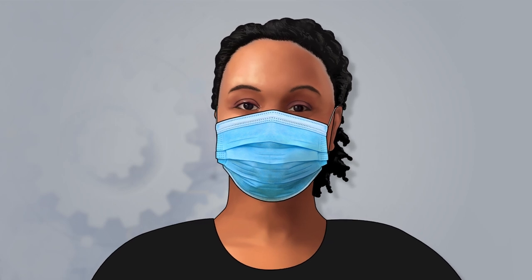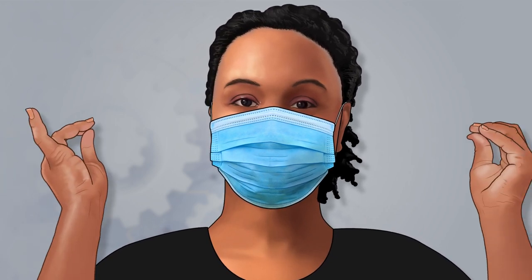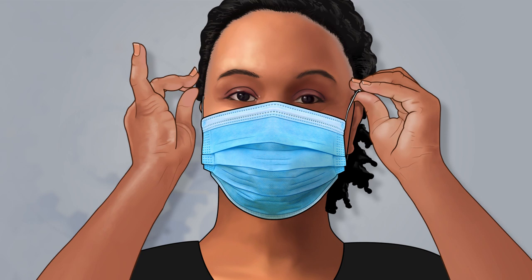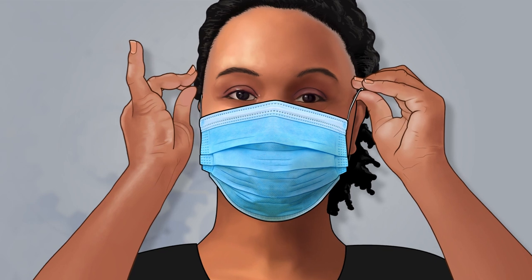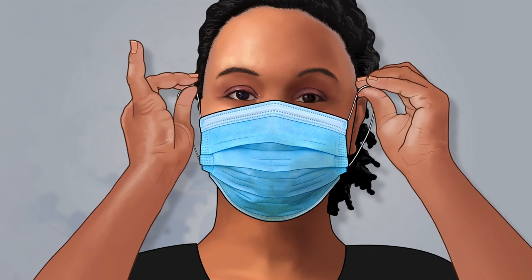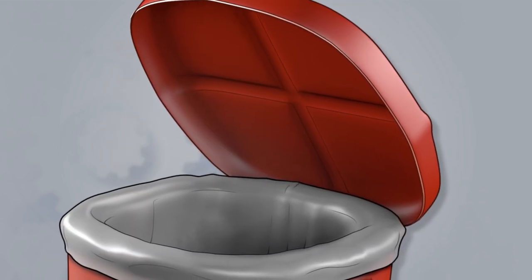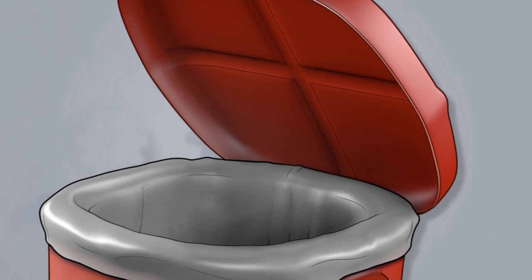To remove your disposable face mask, remove the ear loops, taking care to avoid touching the potentially contaminated exterior surface of the face mask. Pull the face mask away from your face and dispose of it in the biohazard waste container.